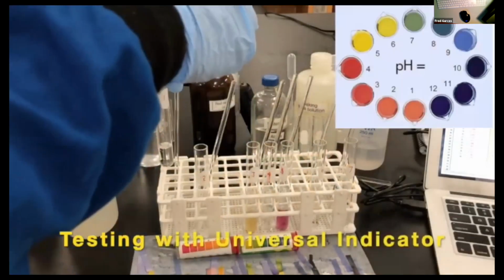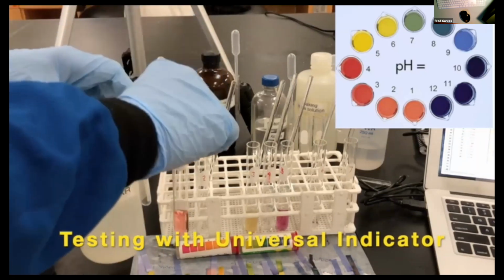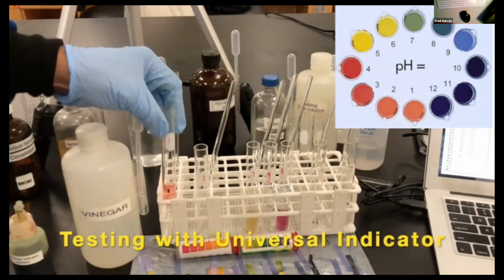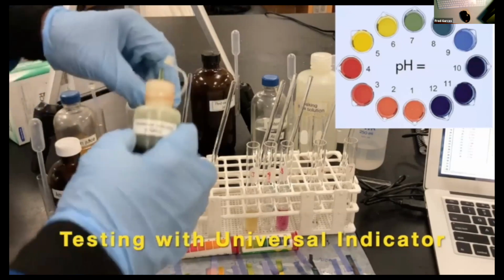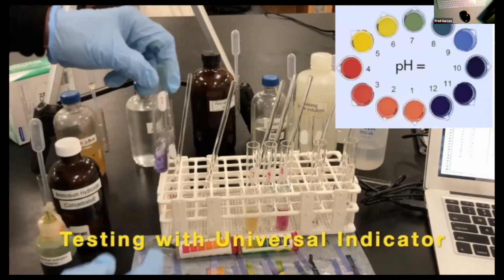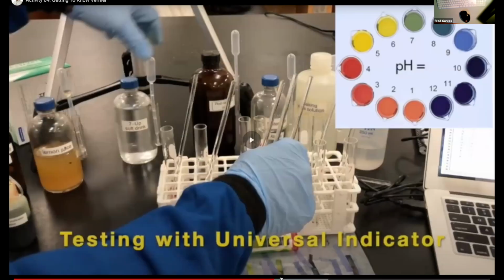Now I'm putting in here some universal indicator, and the universal indicator legend is to the right. So I'm taking the whole solution now, and I'm putting in universal indicator. Again, it'll give you some sort of pH range. And I'm putting another drop or 2 into the ammonia. You will use the legend right here to the right to give an approximate pH of what that is. I'm going to fast forward.